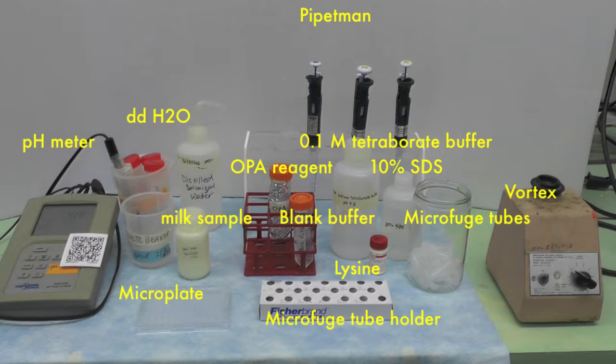This video will demonstrate how to perform lysine determination using a spectrophotometric assay. Here is the equipment you will need.